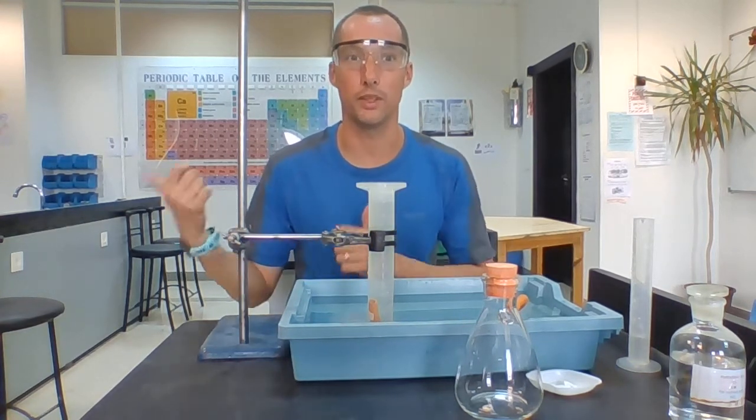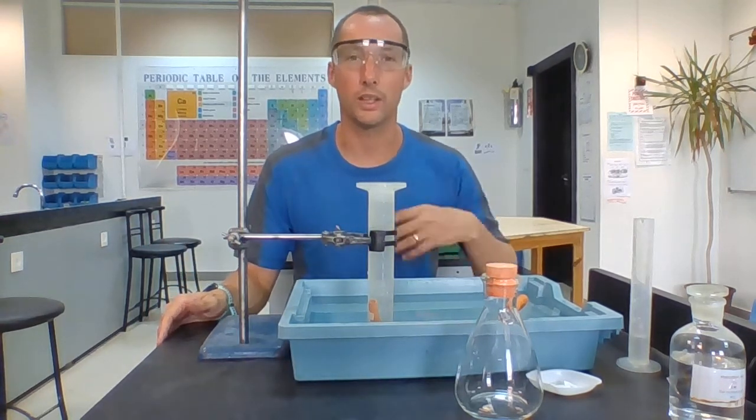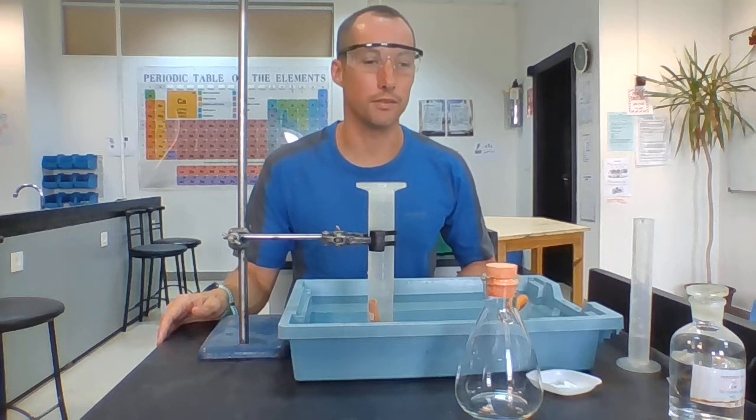Now I haven't got enough hands at the moment to do all this. Ideally, I'd like someone to help me who's going to do the timing, and hopefully when you guys are next back in school, we can have a go at these experiments. You can do them for yourself.